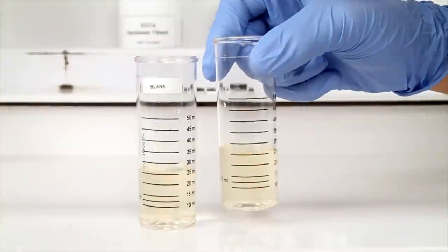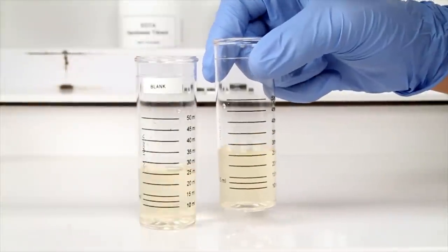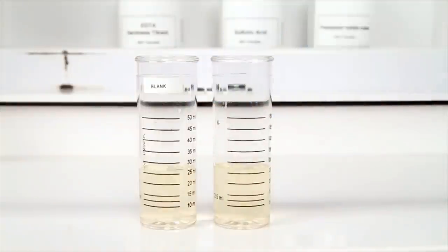According to the endpoint ID procedure, the titration is complete when the vial containing your sample matches the color of the blank sample or until no further color change occurs.